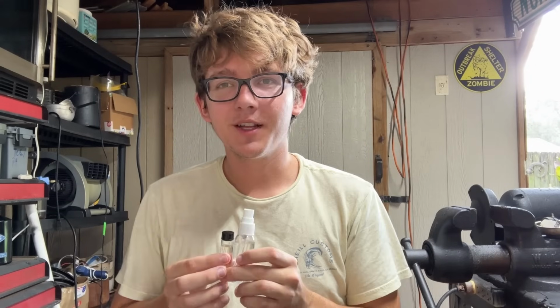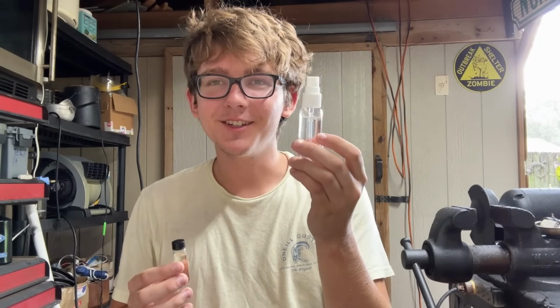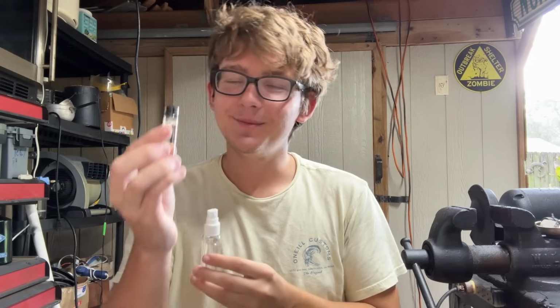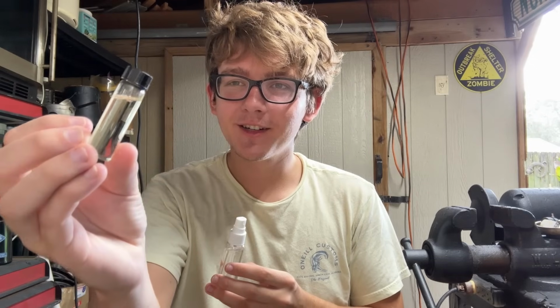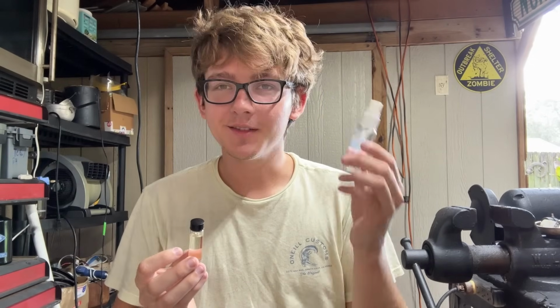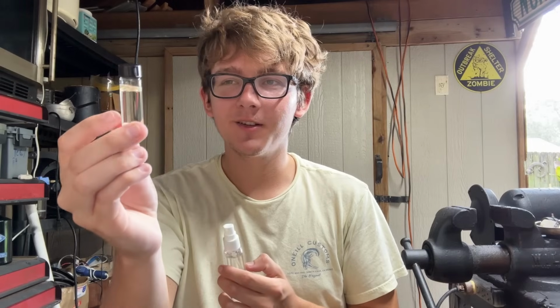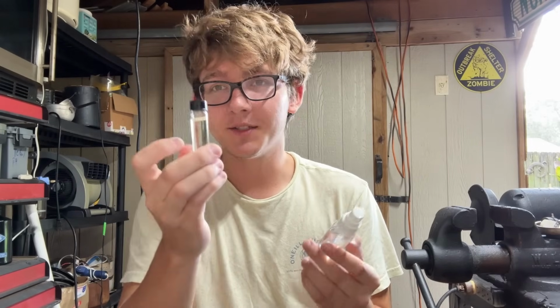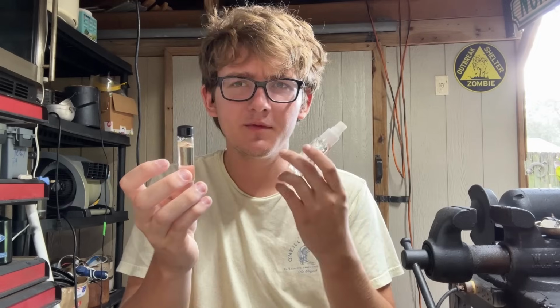So that wraps up today's video, and here's our cologne, perfume. Smells amazing. And here's our pure isovaleric acid, which is the essence of stinky feet. And just remember, keep that isovaleric acid away, or else your feet are going to smell really bad. Sweat kind of smells like this too, but feet more so.